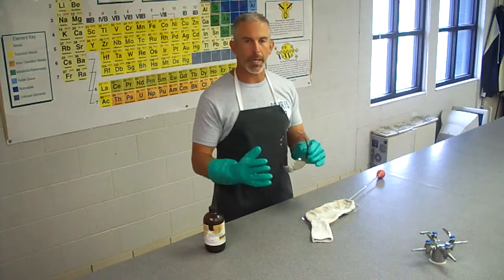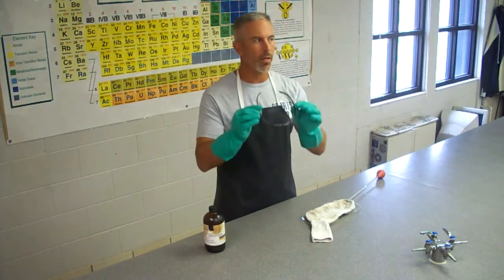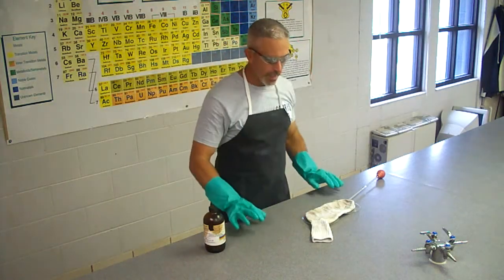So as you can see, I've got my chemical resistant gloves on, my lab apron, and my splash goggles. Okay, and I'm ready to begin.